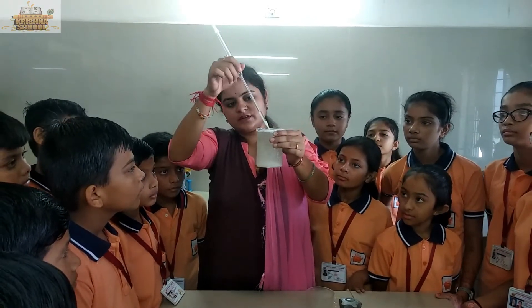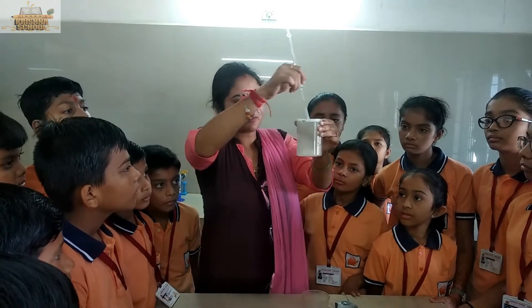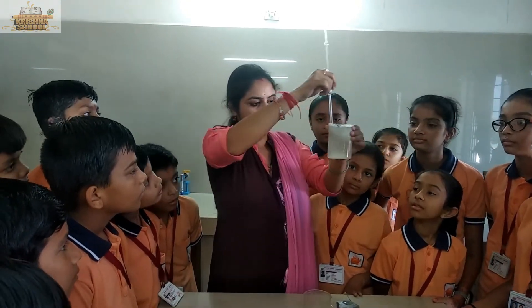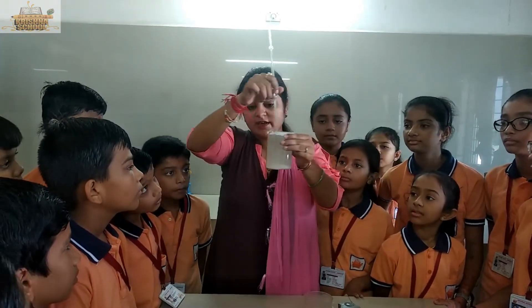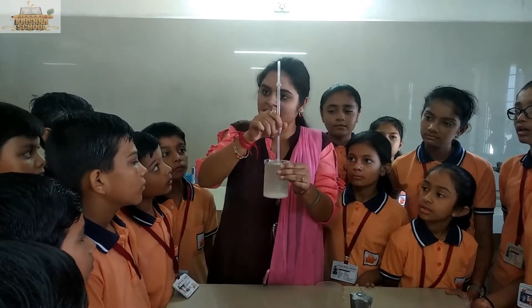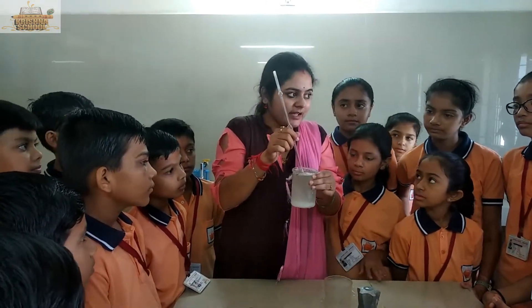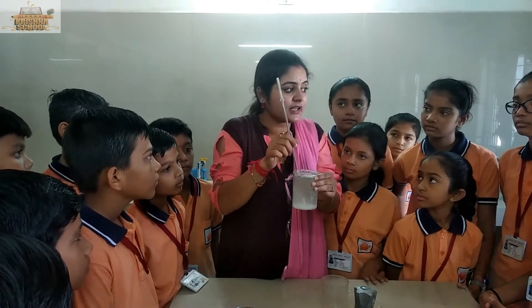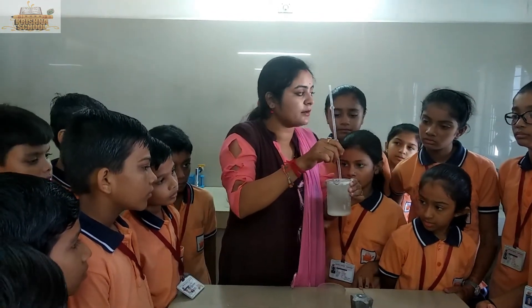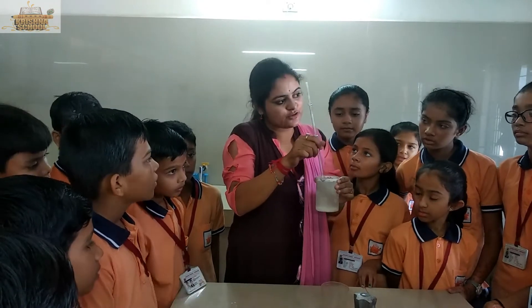Now students you can see that all the salt particles are dissolved in the water, so now this solution has become unsaturated. By adding hot water or by heating the saturated solution, we can make the solution unsaturated.